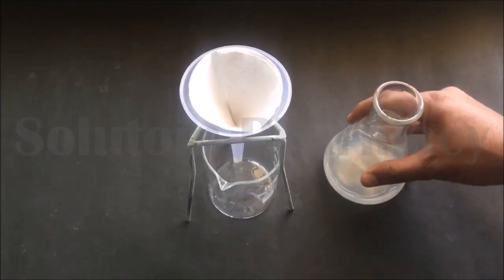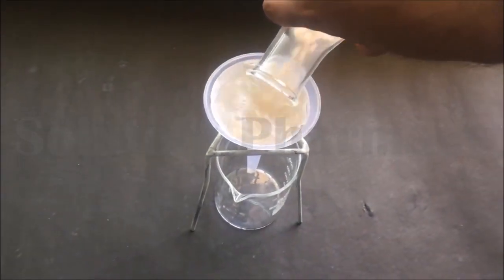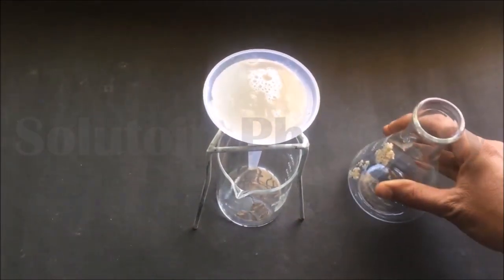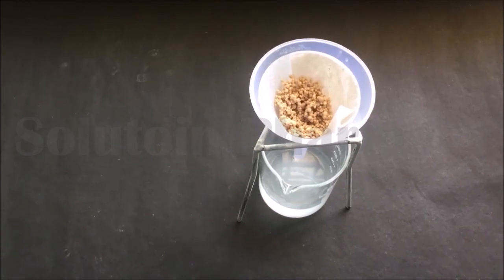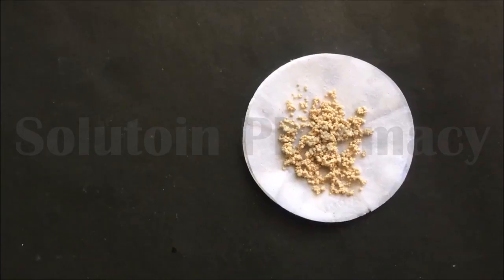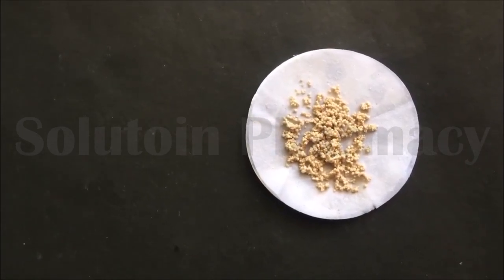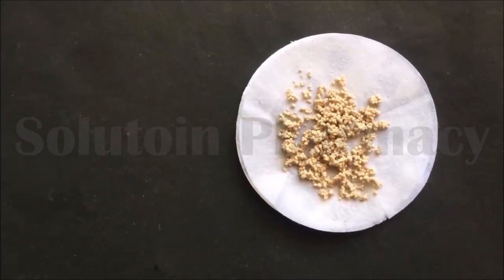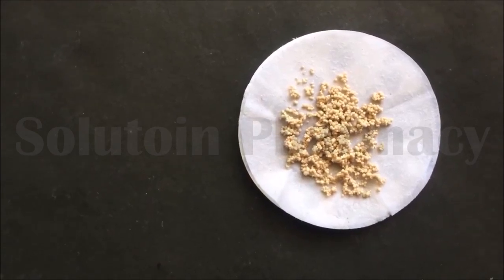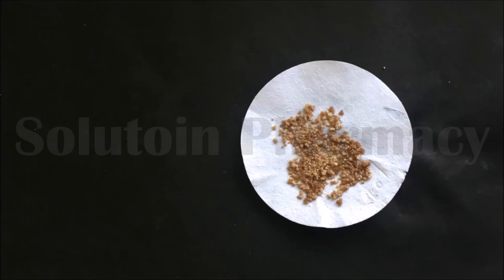So we can easily recover the immobilized yeast cells after the fermentation process by filtration, as shown in the video. You can see on the filter paper the recovered immobilized yeast cells, and these can be used again for fermentation. This is the advantage of immobilized cells or enzymes in the fermentation process compared to unimmobilized cells or enzymes.